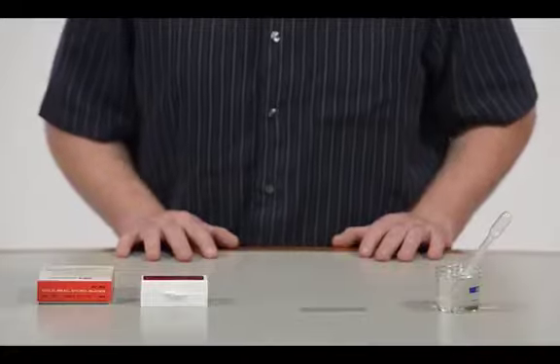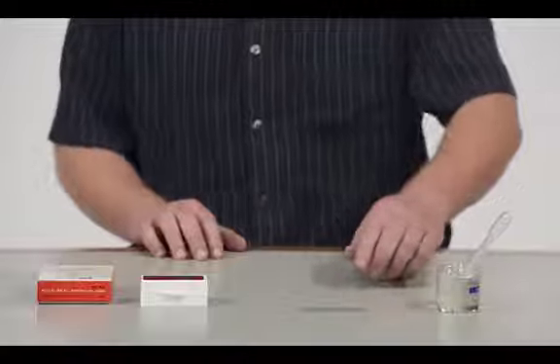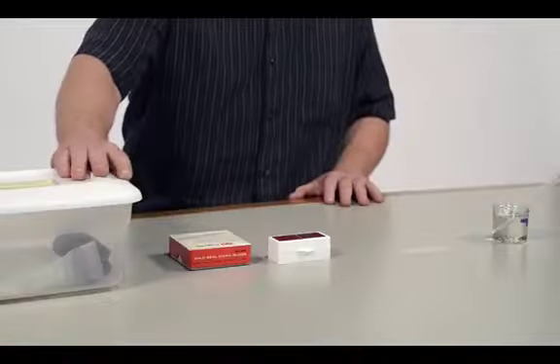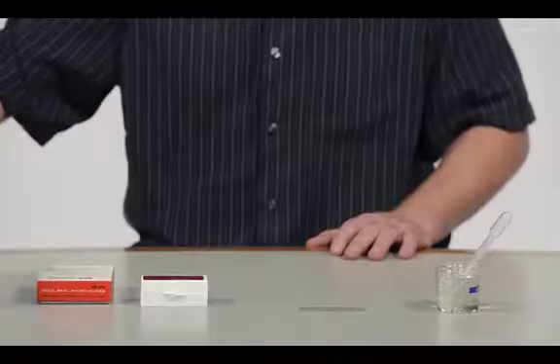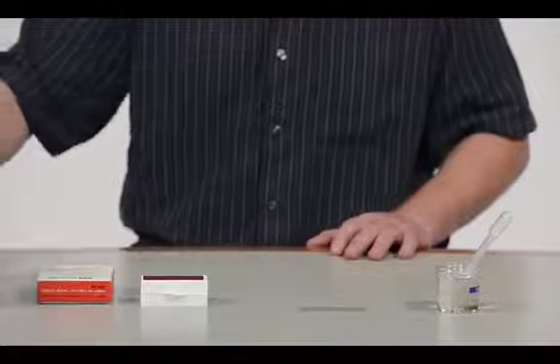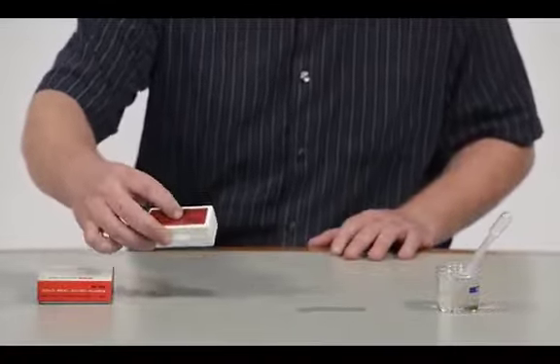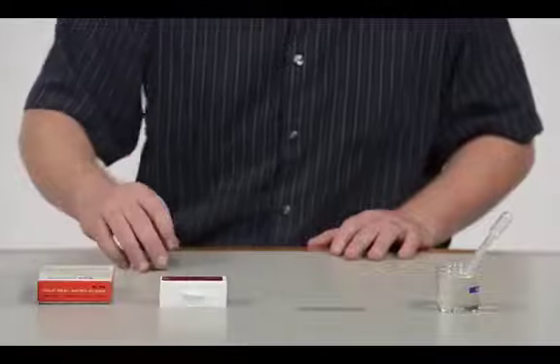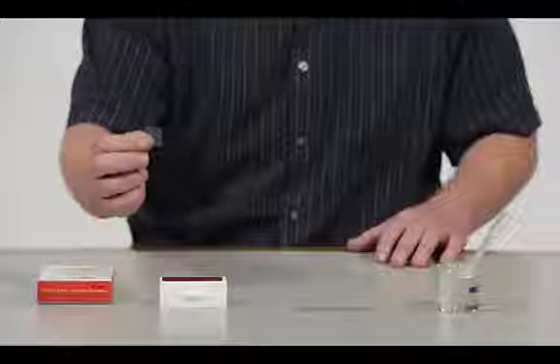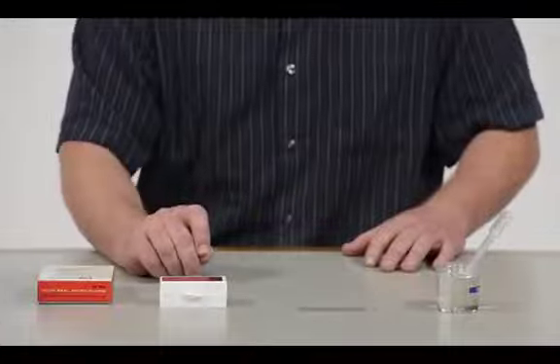Now that we have an idea of the parts of a microscope, let's make a slide and have a look. First, make sure that you have a clean slide. All of the pieces you will need can be found in the kit at your lab station. Use the lens cleaner to make sure your slide is free of any lint or large stains. Cover slips can be found in your kit as well. These are new and don't need to be cleaned. They can be very sharp, so please make sure you are careful when handling them. Don't ever walk with a cover slip in your hand. Even a small bump can cause a serious cut.